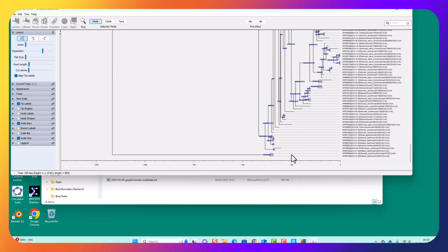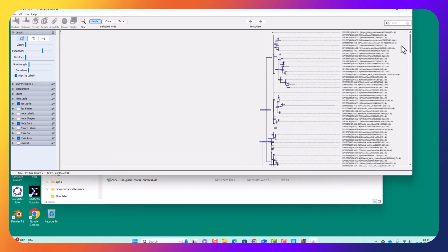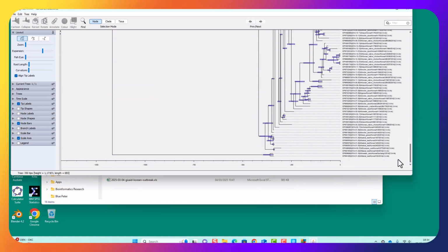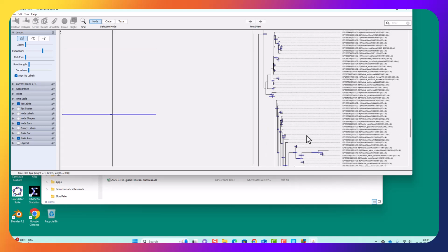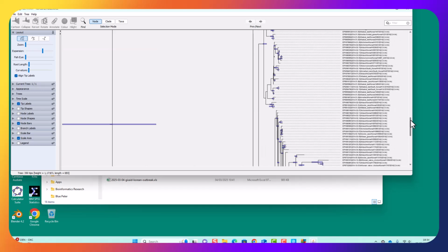So this is minus 1,250 days. So it could go back, and each of these marks is 1, 2, 3, 4, 5. So each of those is 50. So it could be 1,300, 1,350, 1,400. Could be 1,400 days before the last sequence in the outbreak that change happened. So actually 1,000 days before the start of the outbreak, that the split happened between the 2.3.4.4b and the 2.3.4.4c lineages.